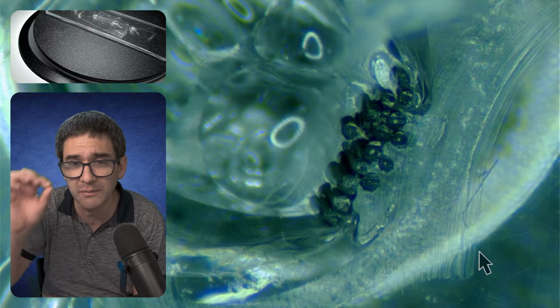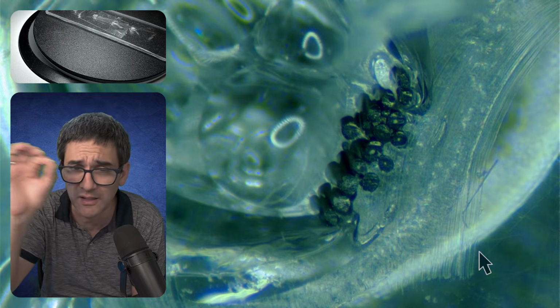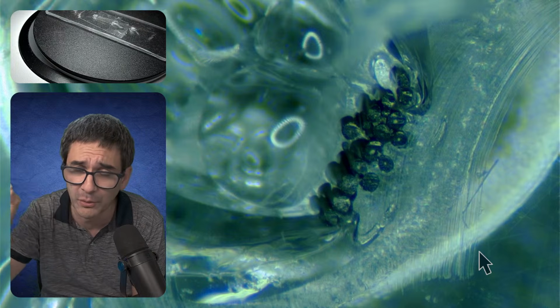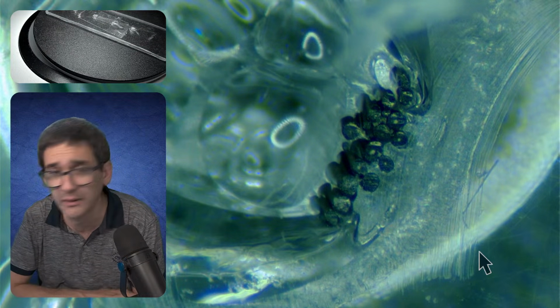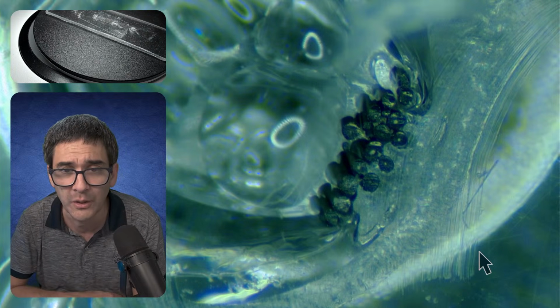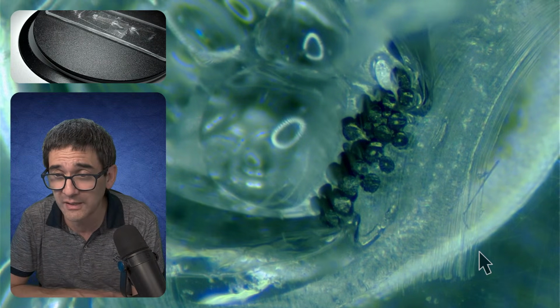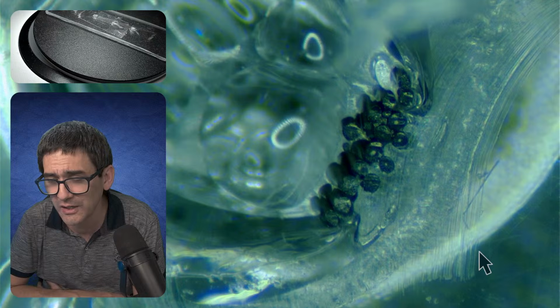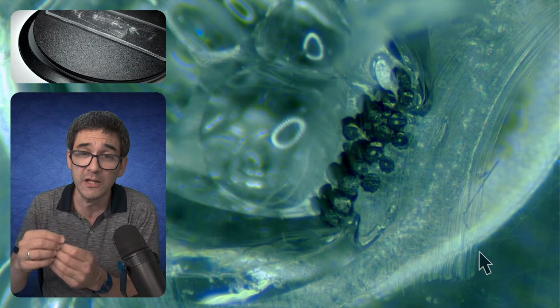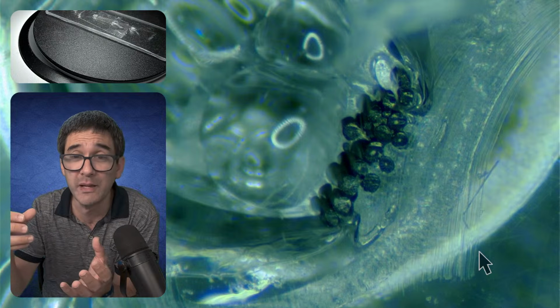It looks hollow. The hair is not hollow, but there is this central part which has a different color, right? So this is something that I'm working on a little bit. I just wanted to share that with you. Not fully successful, but work in progress. What I'm going to do now is I think it might be worthwhile cementing and thin sectioning it, as in mineralogy, in resin first, thinking of maybe embedding the hair in some kind of matrix, maybe epoxy.